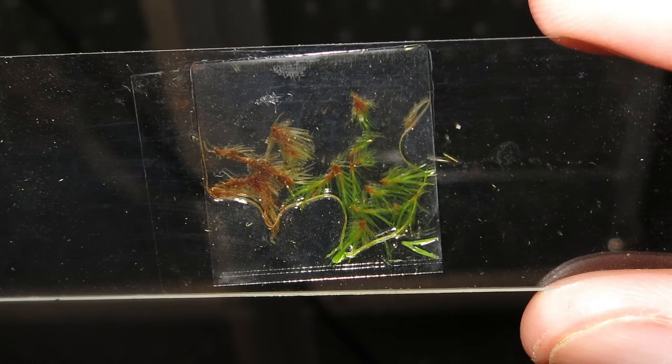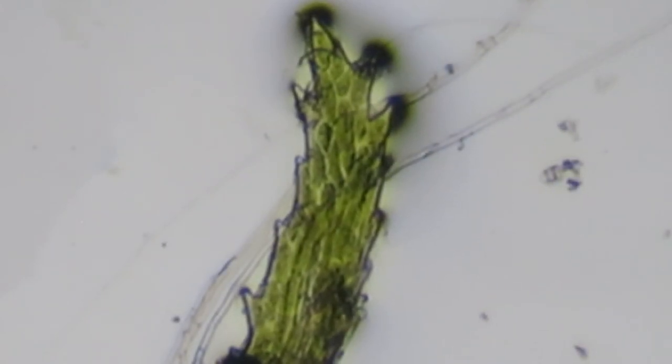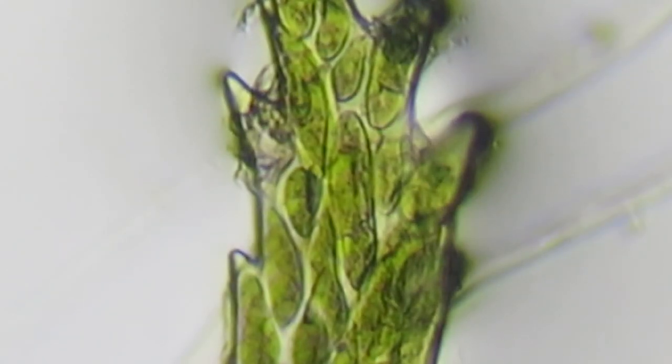Here's the slide we made of the moss. Moss is unlike most plants — it's in its own phylum called Bryophyta and it has simple leaves which are usually one cell layer thick. As we get in a little closer, you can actually see the individual plant cells, and within those cells you can see the chloroplasts which contain the green pigment chlorophyll. Using the power of the Sun, it converts carbon dioxide from the air into sugar that the plant can use for food. The byproduct of photosynthesis, as we all know, is oxygen, which everybody needs to breathe.